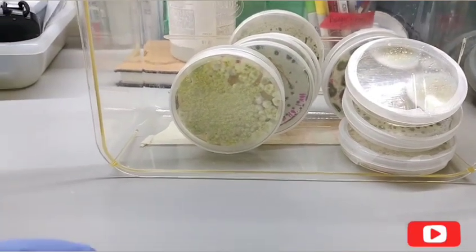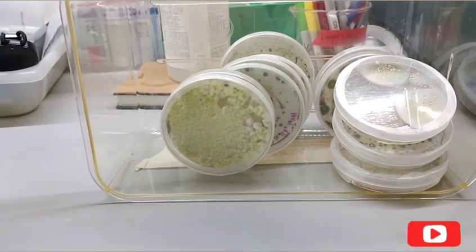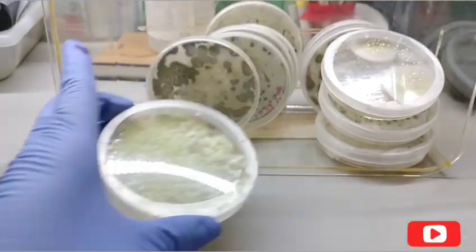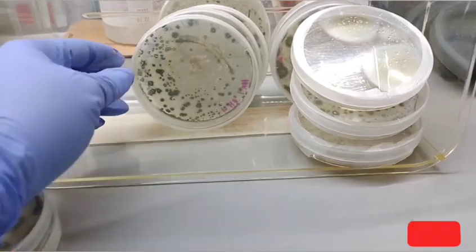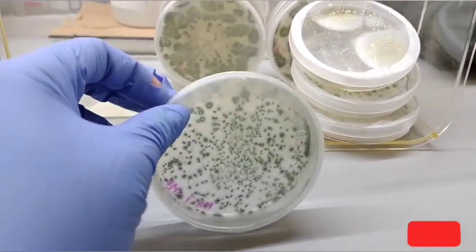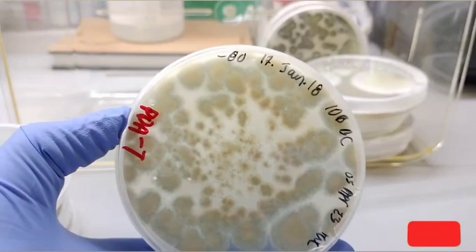So I figured, you know what, many people probably have been using the everyday working cultures, the daughter ones. So I went back to the original to culture some out, to take a piece and grow. And all the ones that I've cultured out show contamination. This is not good. It's not good when your parent sample is contaminated, because your parent sample is the backup in the event that all the other ones, the everyday ones, are contaminated and don't work.